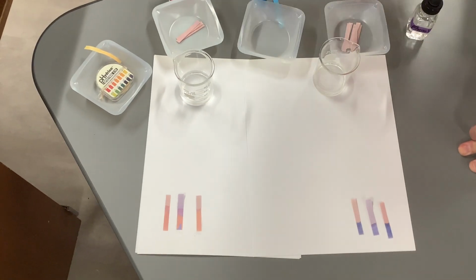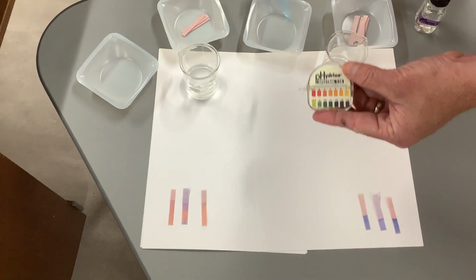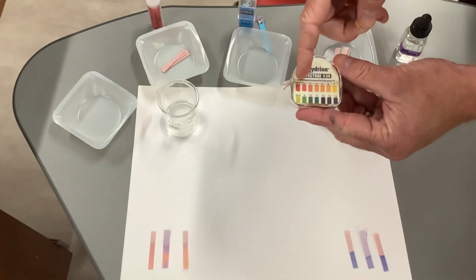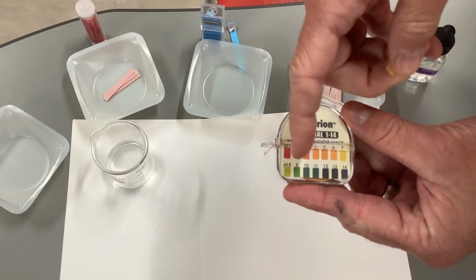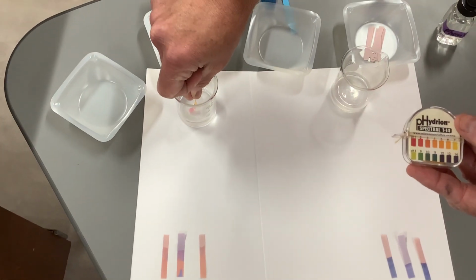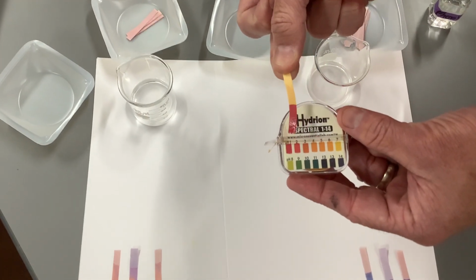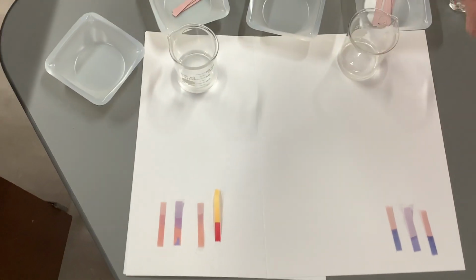And then we have pH paper, and pH paper is based on a scale. So you can see it's 1 through 14. 1 is reds, and then it gets kind of orangey, and then yellow, and then greens. After 7, it gets green, and then turns towards blue. So when I put my pH paper in this acid, you can see it, and you compare it to the color it changes. So this is a pH of 1 because it's hydrochloric acid, so it's a very strong acid.